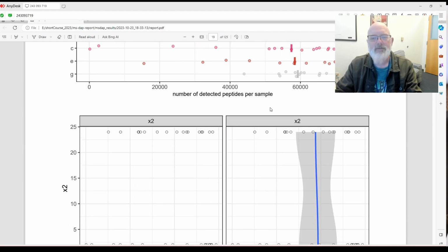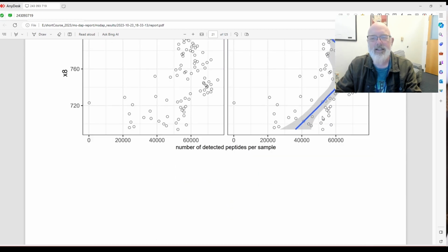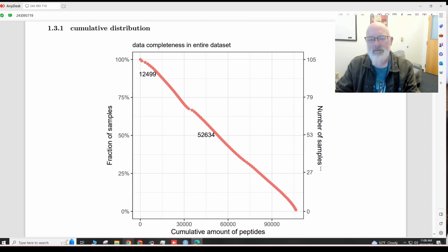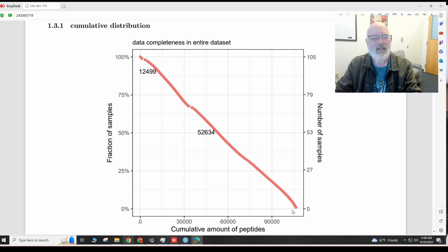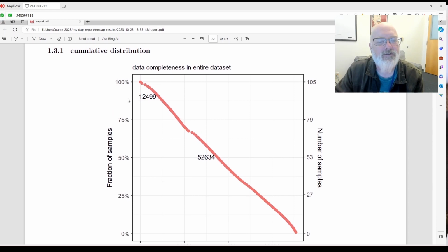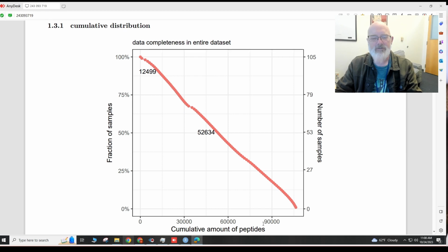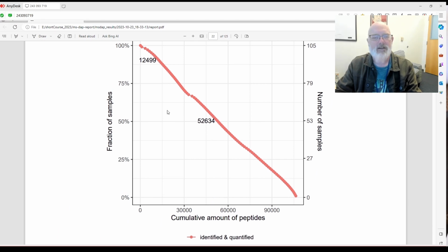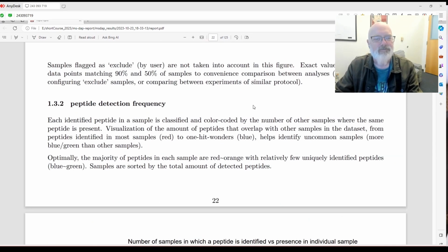Okay, number of detected peptides per sample. Okay, that's really cool. And it breaks it out by the metadata. I really like that. That's really nice. Okay, data completeness. This is really cool. So number of samples, you see we actually have 105 samples, and this is the cumulative amount of peptides and what percentage of the fraction of samples. So basically what this is telling you, and I think this is the number either for here or here, but 12,499 peptides were in most of the samples. And you can see we have 90,000 peptides total. And 52,000 peptides were in 50% of the samples. And remember, we're using different sample prep techniques, so that's not really that uncommon or surprising.